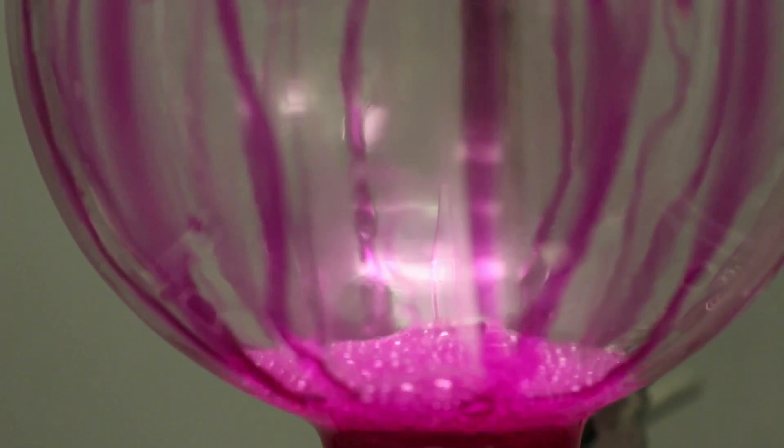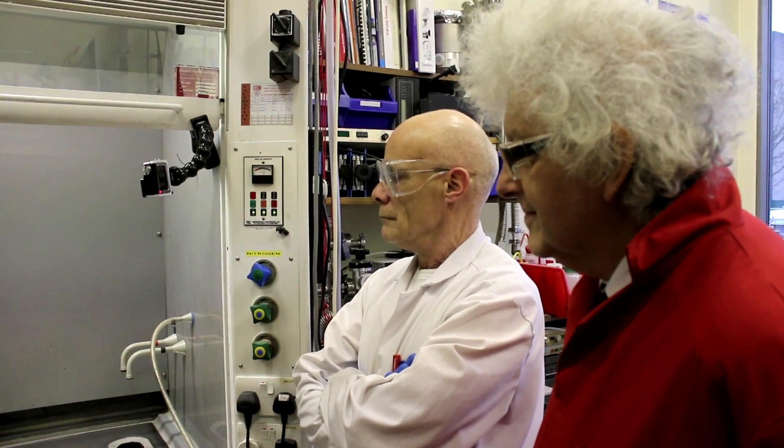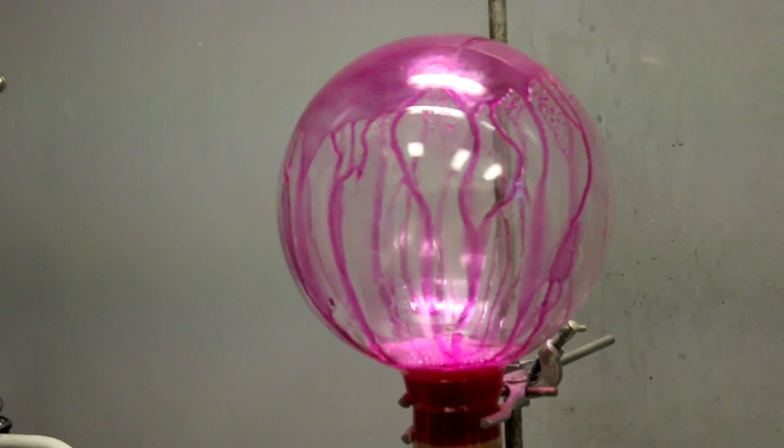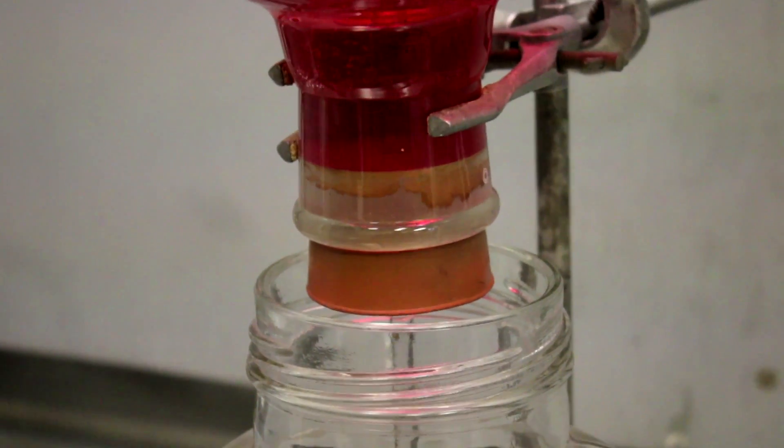Neither Neil nor I had ever seen it before. There was a slight problem that the bung hadn't been pushed in quite hard enough, so a little air was leaking in as well. But that caused bubbling, which probably added to the effect.